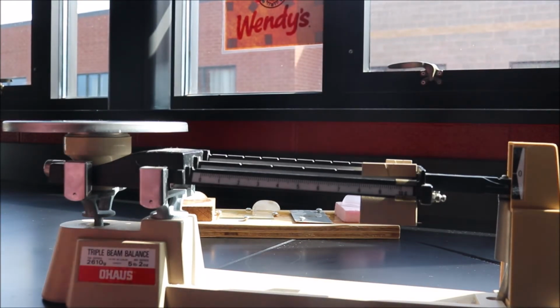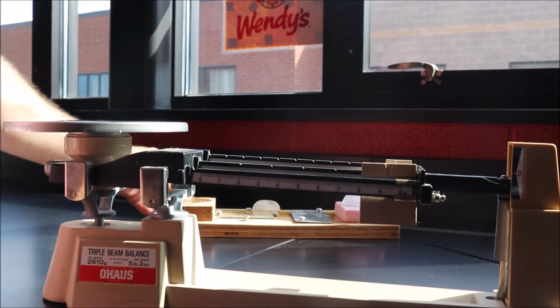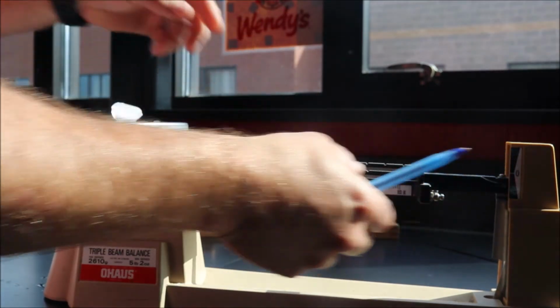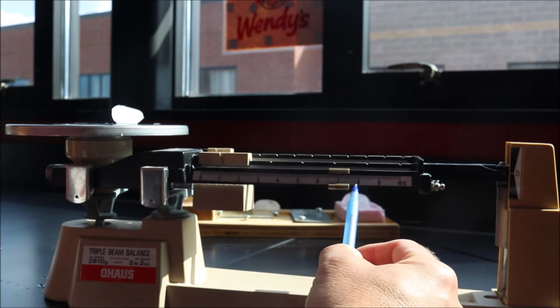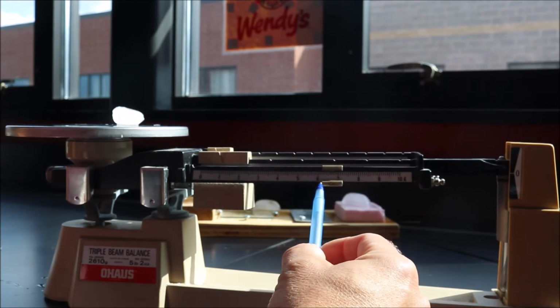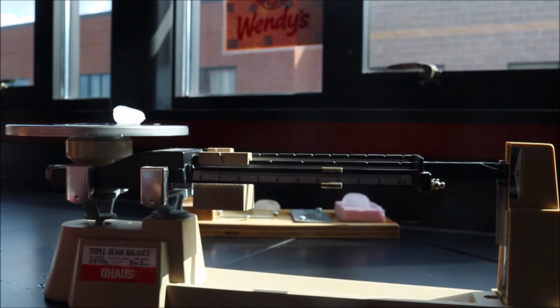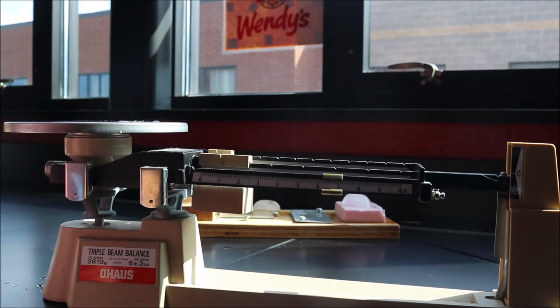So let's see what the results were for our mini experiment here. All right, if we start with the piece of wood, ice cube number 1. Let's find out how much mass is left on that guy. So, at least 4. Okay, it's around 7. Let's say 6.5. Let's say 6.7. All right, 6.7 grams is what ice cube number 1 was.